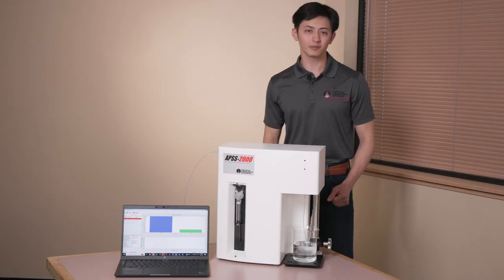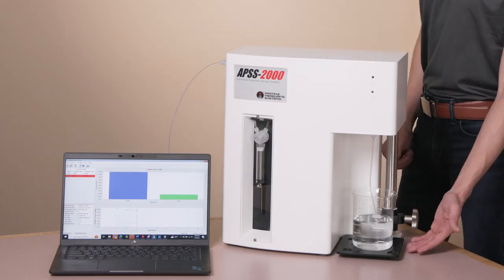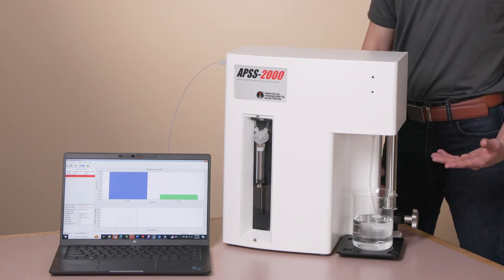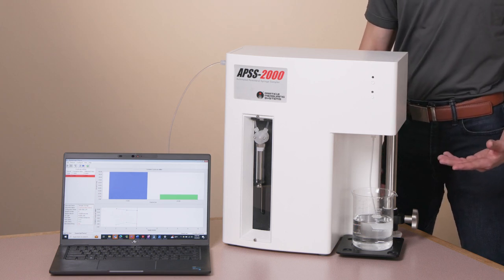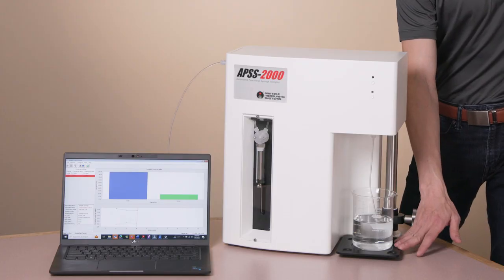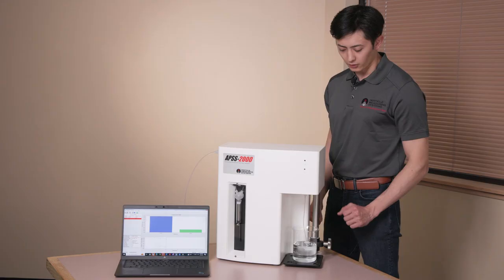Taking a closer look at the instrument here, we have an adjustable stage that can be moved up and down based on the size of the container that your sample is being taken from, as well as whatever accessories you're wanting to use. We have a couple of accessories that can be placed on the stage, including a magnetic stirrer and an ultrasonic bath, both of which can help homogenize your sample.